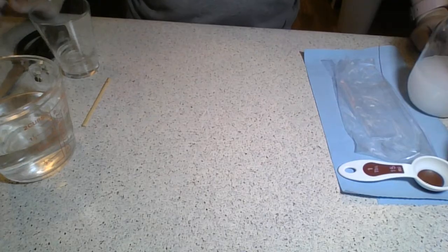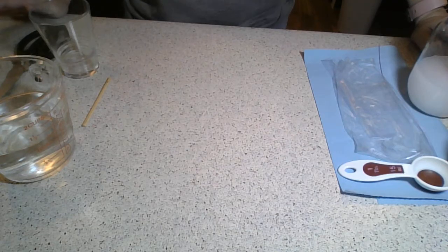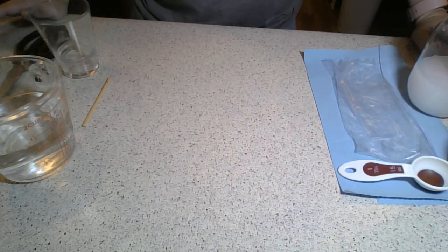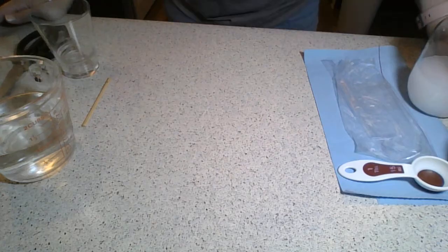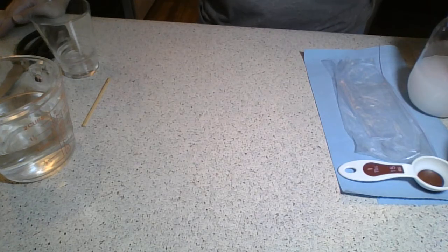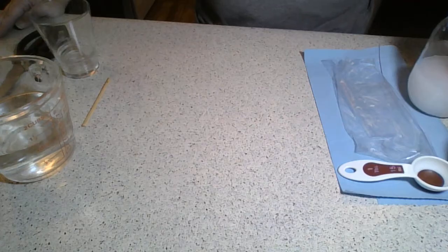My students, you guys should have your lab packet from Canvas downloaded. Make sure you guys have read through it before you continue with the video. We're going to be looking at how diffusion works today — a substance across a semi-permeable membrane — and we're going to be using iodine and starch. Iodine is an indicator for the presence of starch, so we're going to see a reaction happen between the two molecules if anything passes across our membrane. There are some questions for you guys to answer on the lab, so make sure you do that pre-work ahead of time.